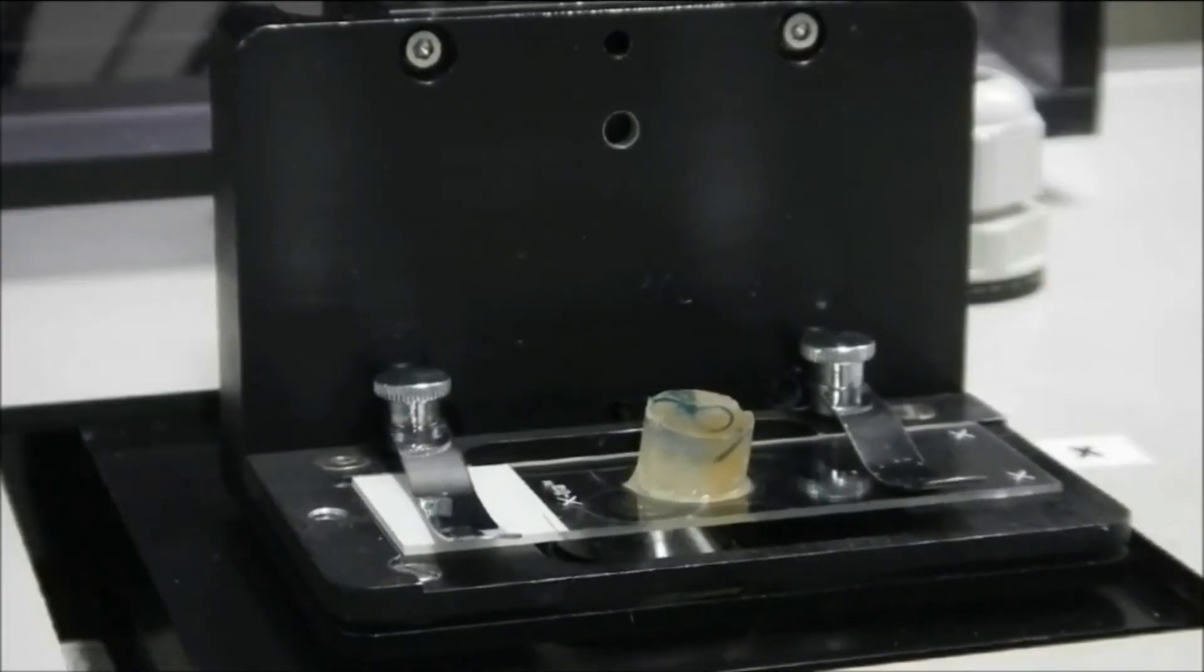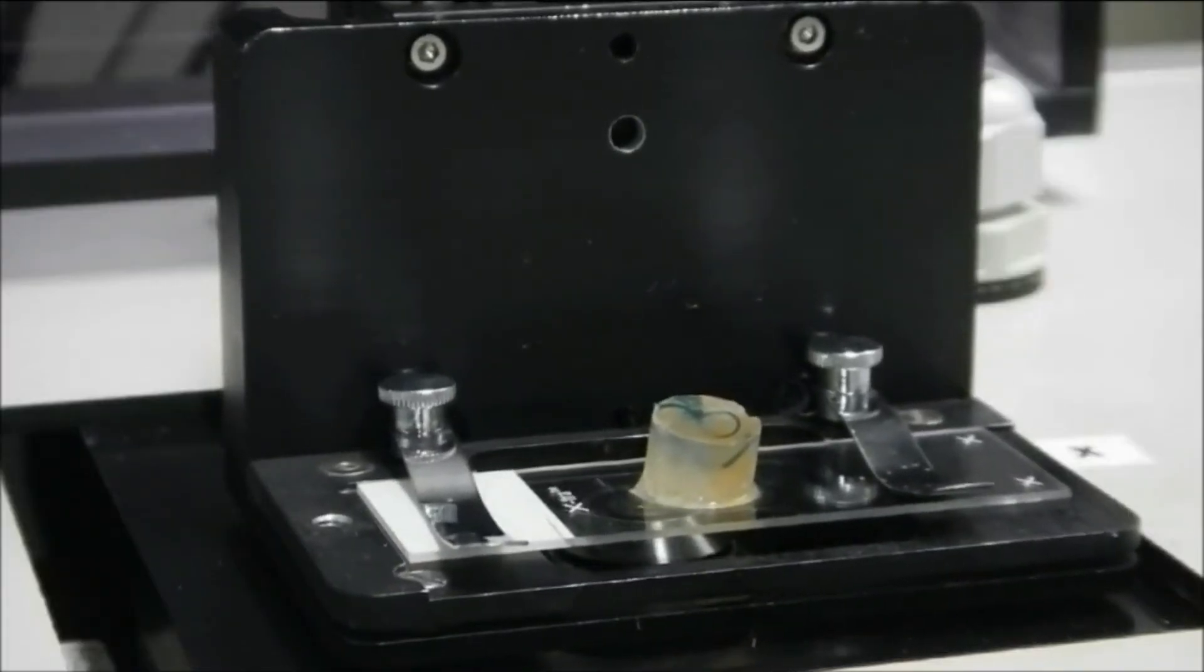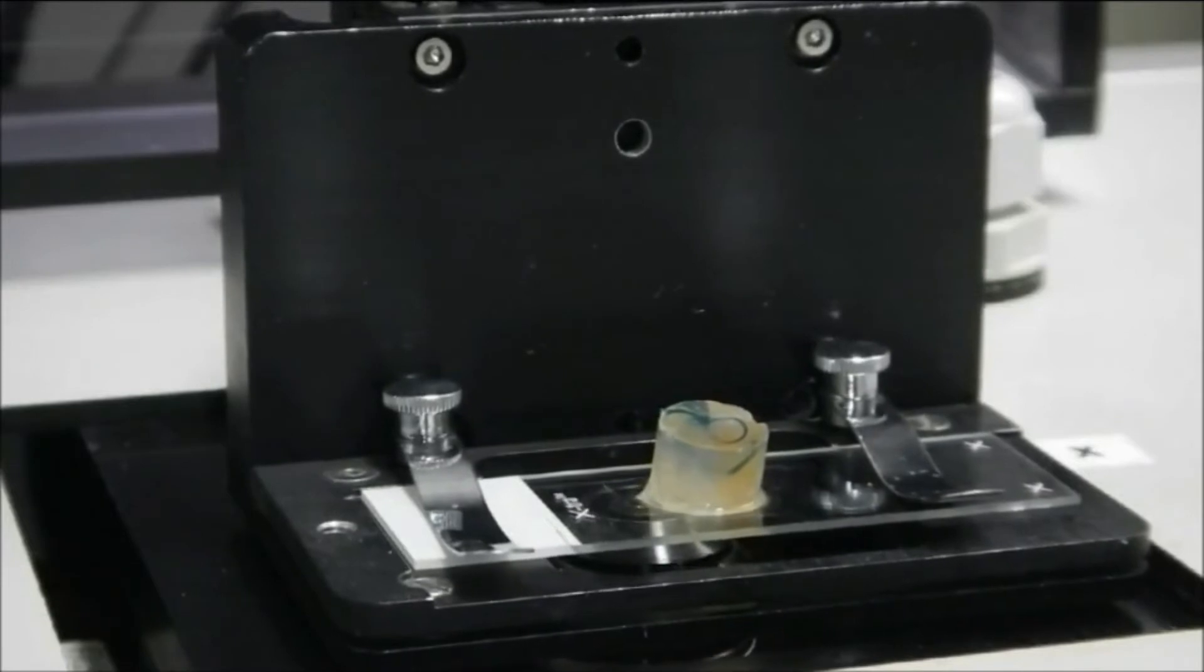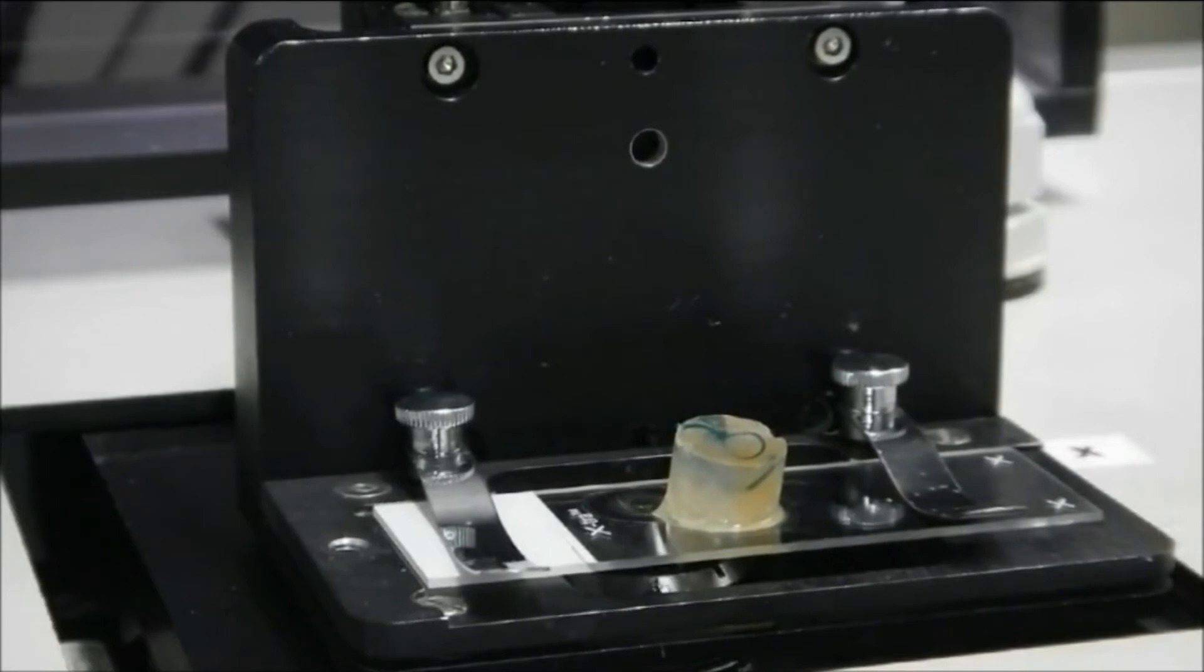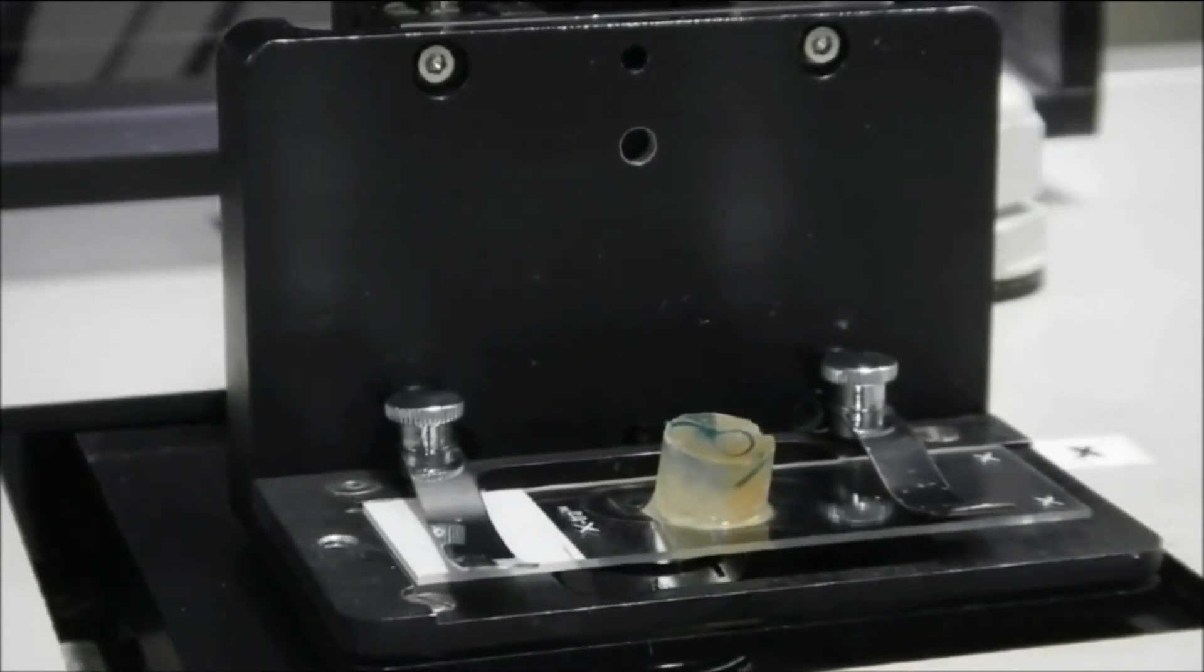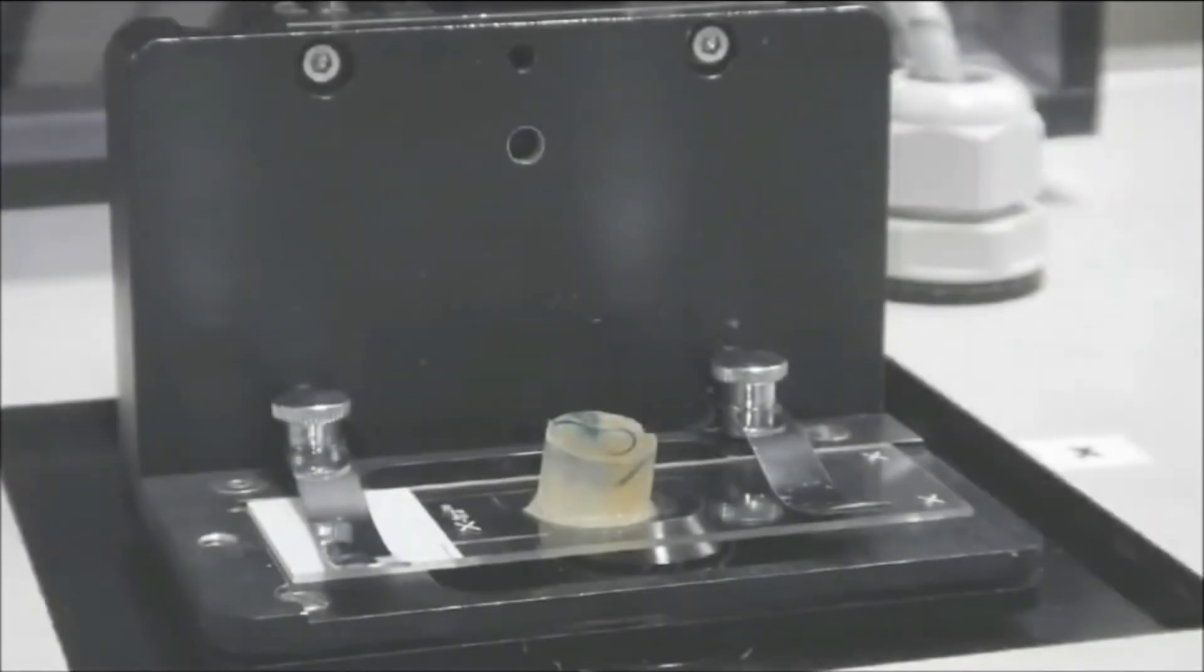The cutting process will now be completed automatically with the cutting time for a sample of the size depicted being approximately three minutes. This time may be used for the preparation of the next cut, the documentation of samples, or the setting out of histological stains.